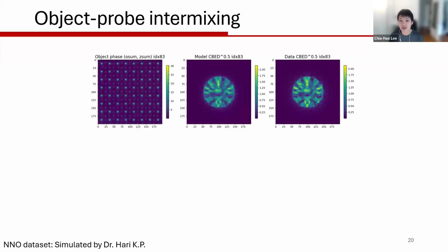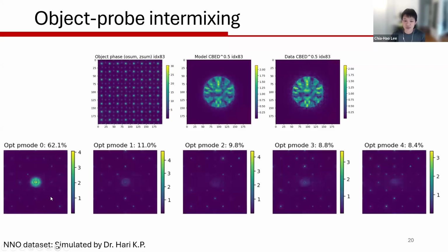Another example is, like I mentioned, the significant amount of object probe intermixing, especially for iterative ptychography approaches. This is very sensitive to the optical condition. For a simulated data set, sometimes you will see this because you do have a very, very strong signal from your diffraction pattern. This is one of the worst examples you can have for object probe intermixing. You can see that the real space probe actually picks up a lot of the crystal structure in your object. One reason is that this is simulated data without any noise or dose put into the data set, so the signal is too strong.